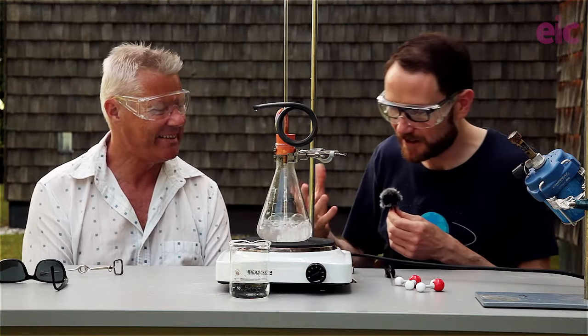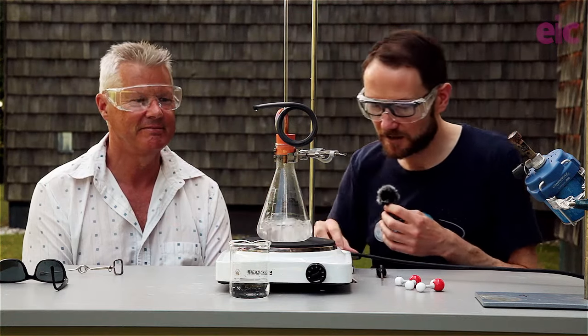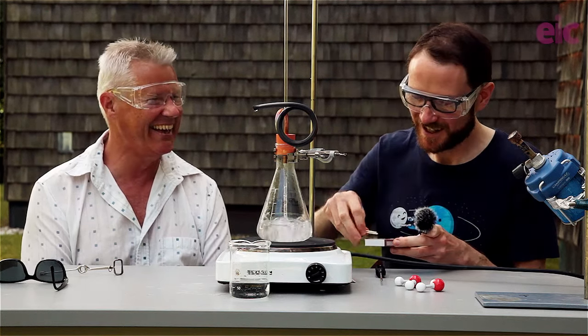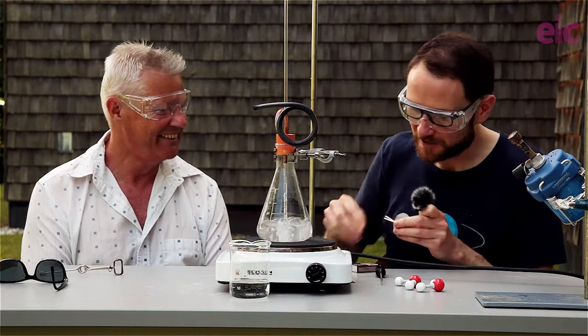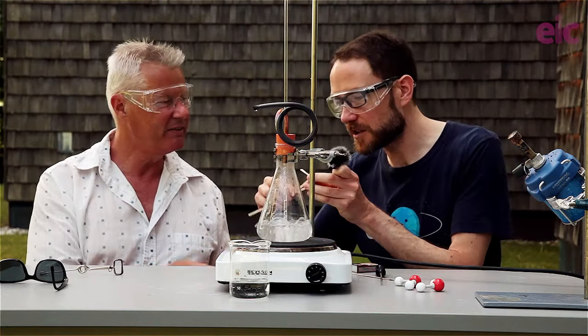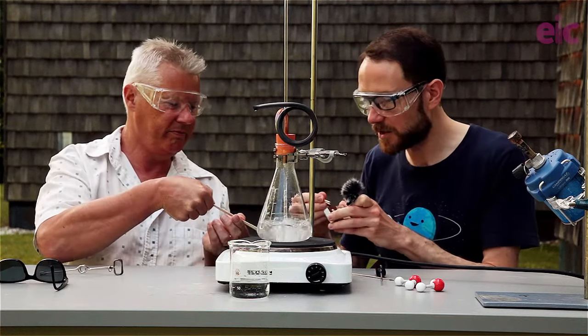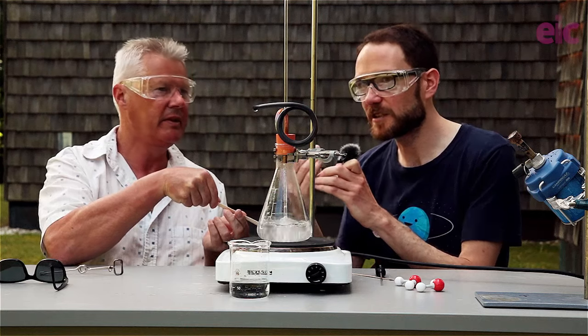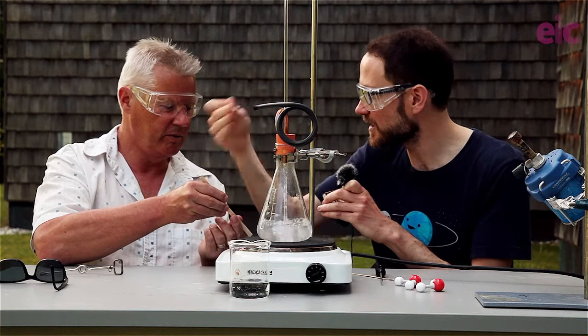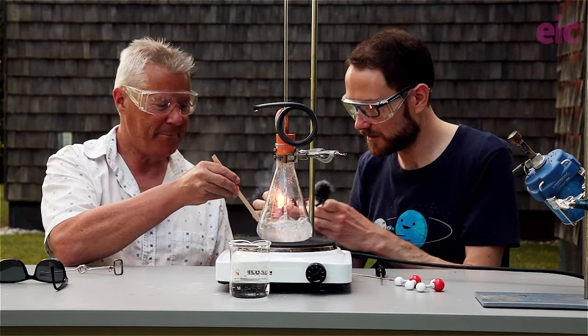So let's now do a little investigation. We've got what we think are droplets of water essentially coming out from the end of this tube. Big science surprise coming up here. You're going to set fire to something. Now, if you were to set fire to something, I've got some splints here. Can you hold those for me? And we've got two of them here just because we're outdoors, a bit of a breeze. And you can hold them downwards to help them keep burning. And the idea is that you want to shelter that. We light it and then you're going to just leave the flame in the end there. And when we light this and you put the flame into the steam, what do you think is going to happen to the flame? The flame will go out. Okay. Scientific prediction. Give it a try.